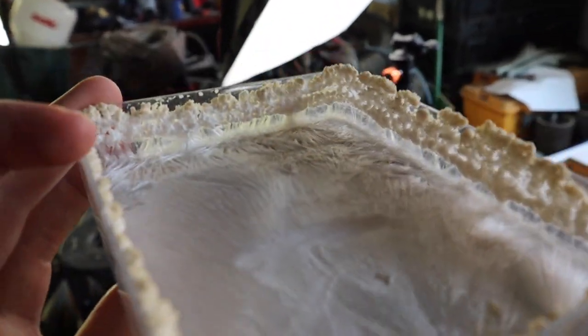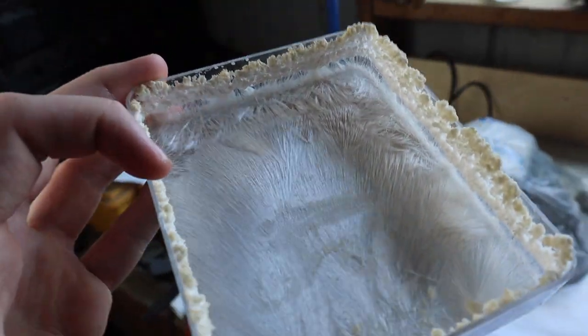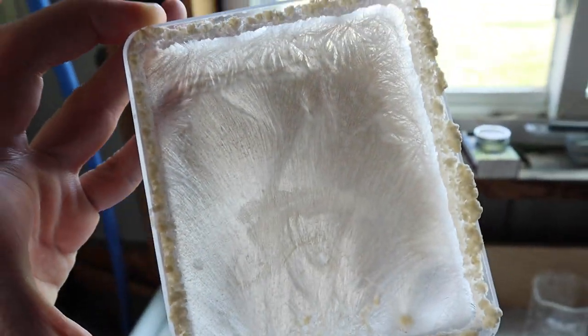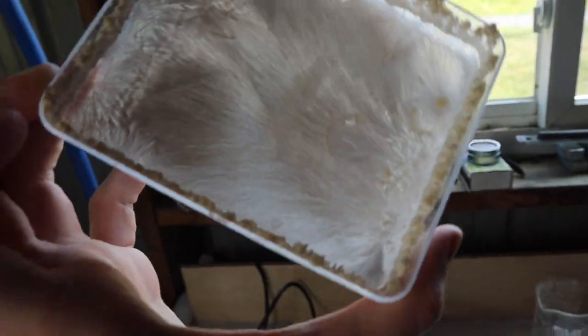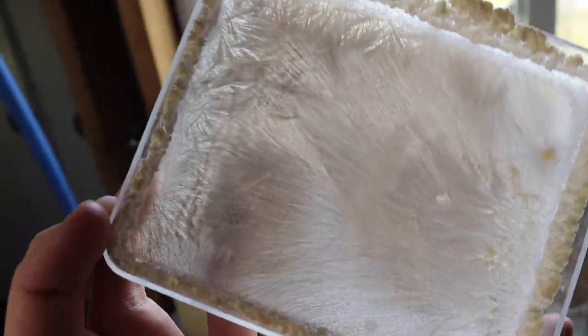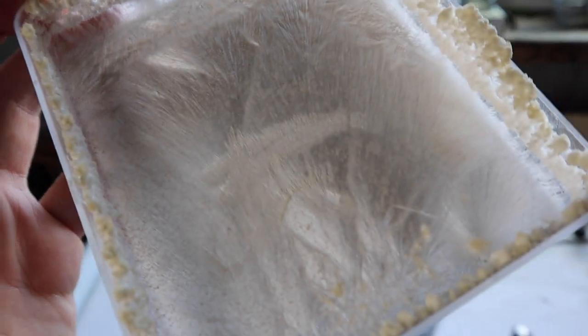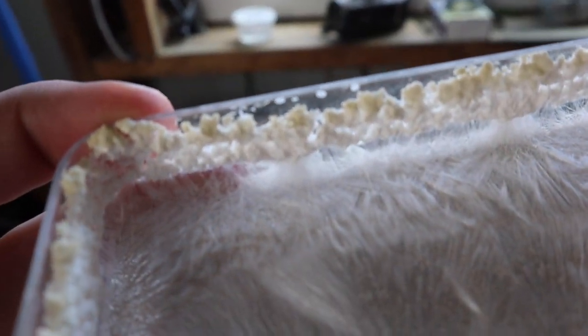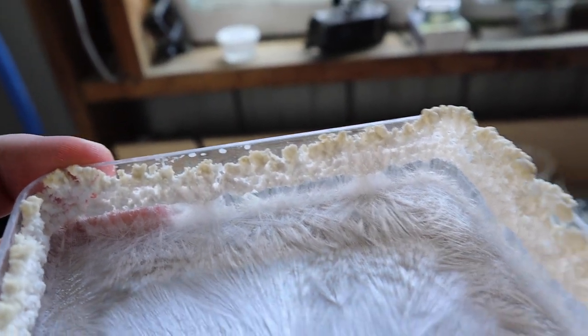I left the beakers full of this stuff out for a little bit too long and they went from a gel back to a liquid. So I just dumped it all into this little tray and allowed it to recrystallize. And this calcium acetate looks pretty beautiful. If I could get it to focus, I'd show you there's some nice spiderweb crystallization.